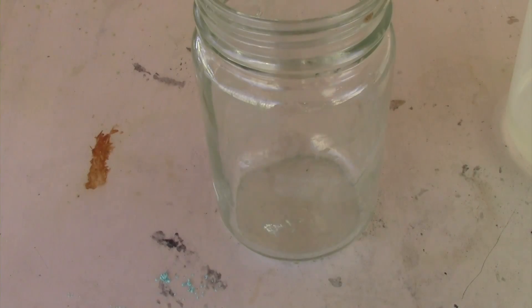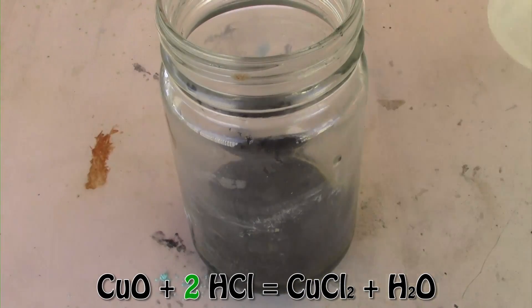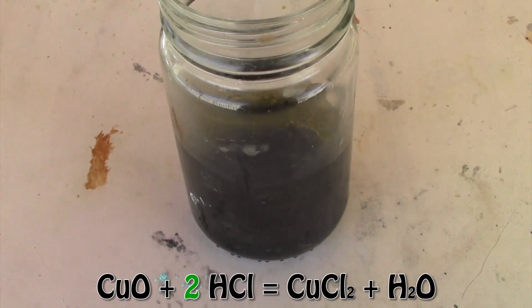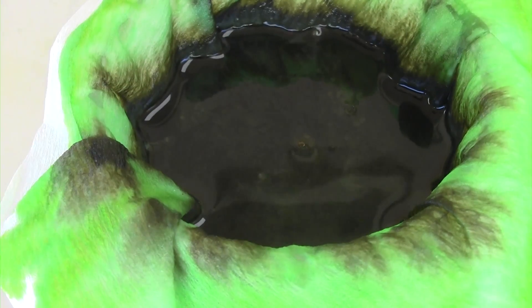The second method will be using copper oxide, which is not the best as there is no indicator when it actually stops, since concentrated copper chloride can be brown to black in colour. The reaction is very exothermic and heats up a lot. I left it going for about 30 minutes and just gave up and filtered what I had.